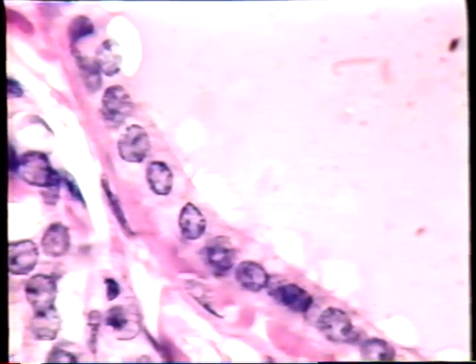And one problem is that it's very hard to see the boundaries between cells. You can sort of sense where one is here, but you really need the electron microscope to distinguish the cellular boundaries where one cell meets another. These cells manufacture the colloid, which is in the colloid space here. When they're active, they tend to be quite tall. When they're inactive, they tend to be quite flat. Let's go now to the electron microscope and have a look at an electron image of the simple cuboidal epithelium that lines the thyroid gland.